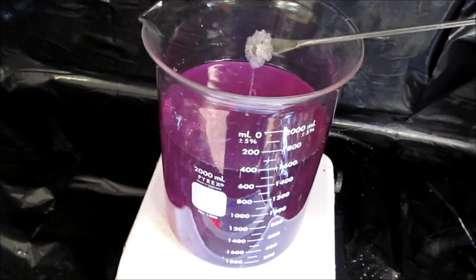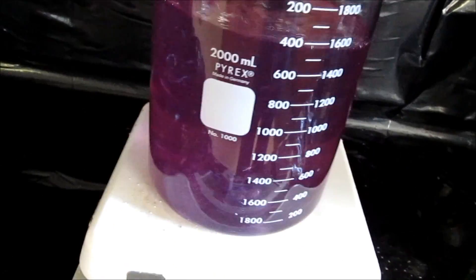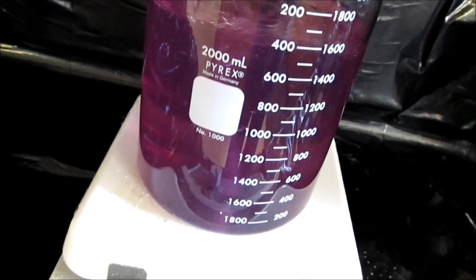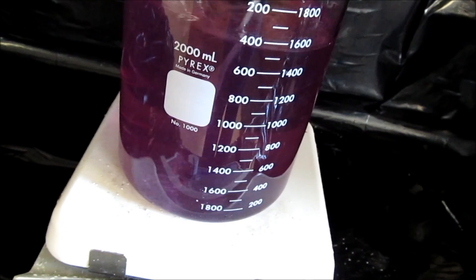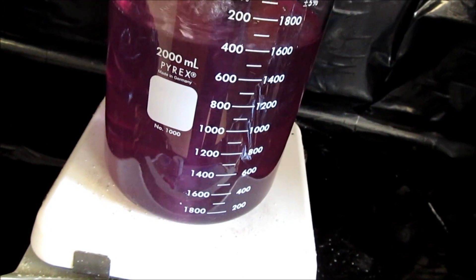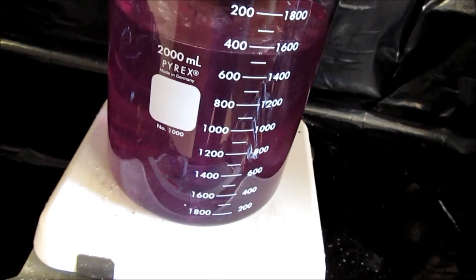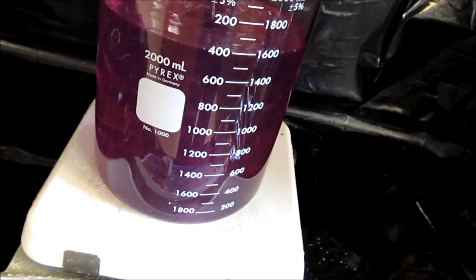You can see I'm getting this little bit left. All that's already almost all dissolved. Won't be too much longer. We still wind up with a film on the very top of it sometimes, but once it cools down that film disappears. It's kind of wild.